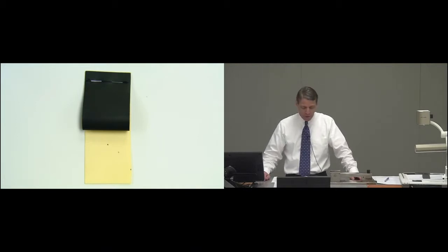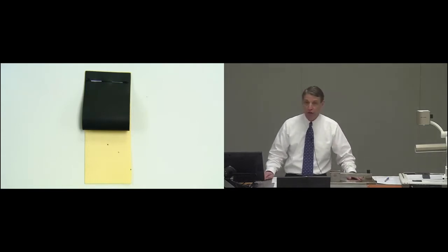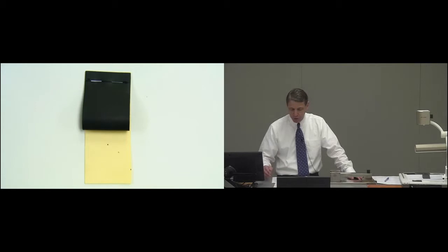I'm recording videos to demonstrate the ASTM test methods to measure the index and certified properties used to assess or evaluate geomembranes for environmental containment applications. Today I will demonstrate ASTM test method D1790, standard test method for brittleness temperature of plastic sheeting by impact.